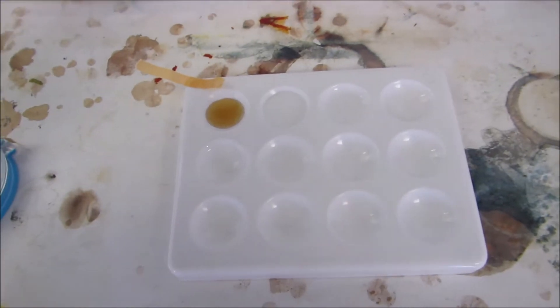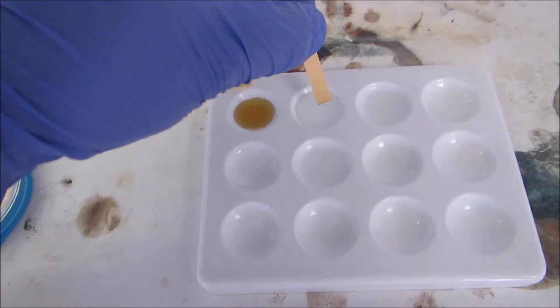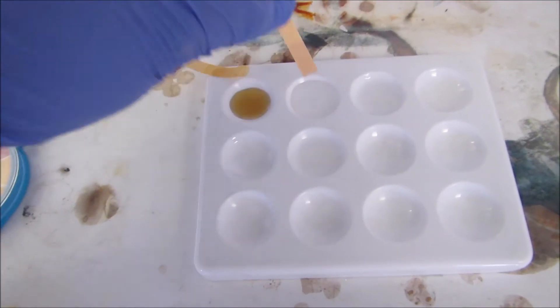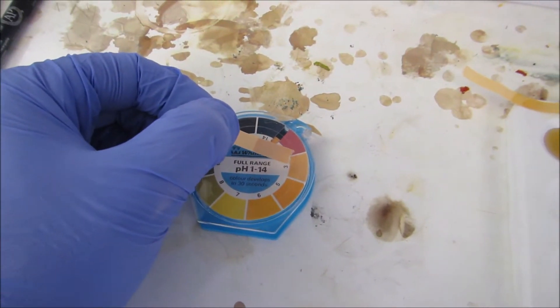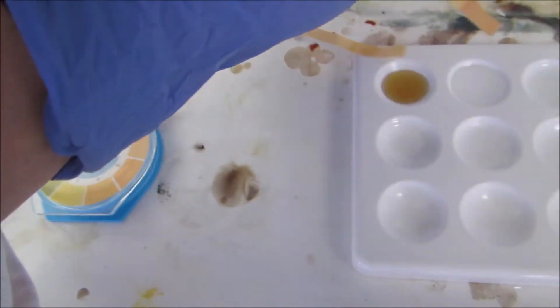Next one is our carboxylic acid. I put it in and from the color it's around pH 3, so this is acidic.